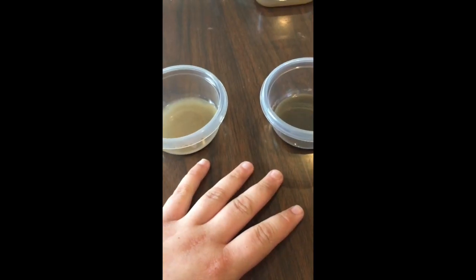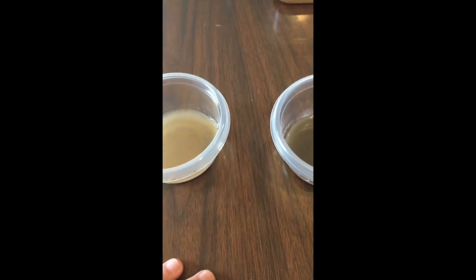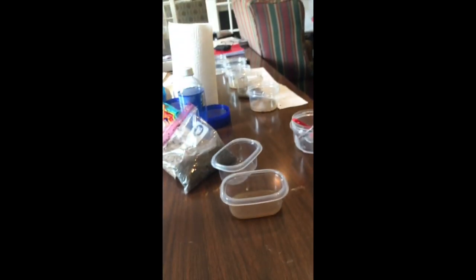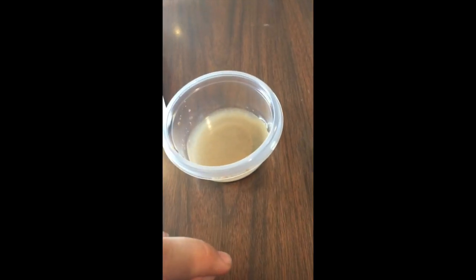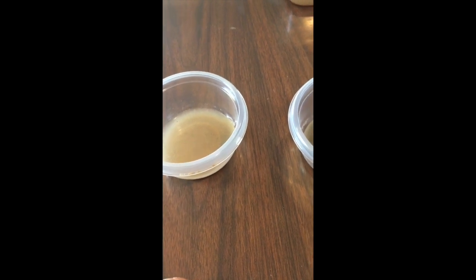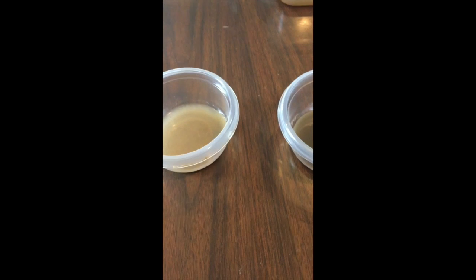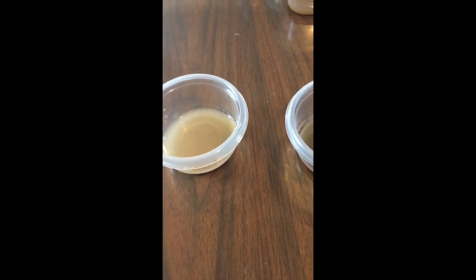So as you can now tell, there's a difference. I've gone in and done an extra step or two, where after the sediment had settled in the bigger cups, which are now down there, I proceeded to, like it said, decant most of the water out of each cup and transfer the sediment into 50 milliliter graduated cylinders. Now, unfortunately, I do not have those here with me, so I had to improvise and use something different.